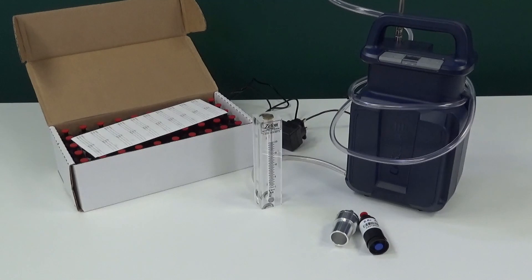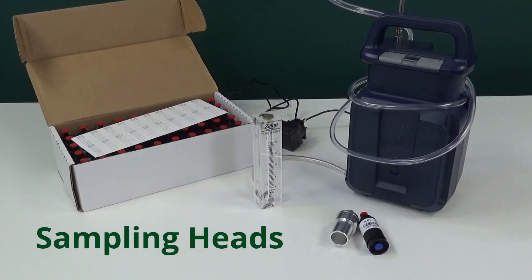The sample train is the combination of the pump, pump accessories, tubing, filter, and sampling heads.